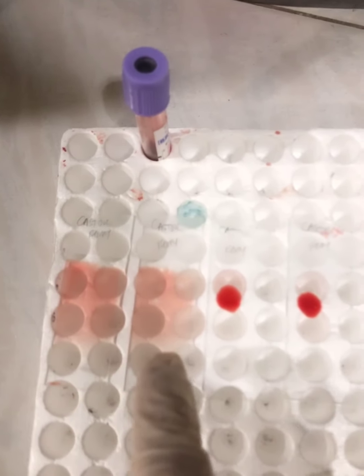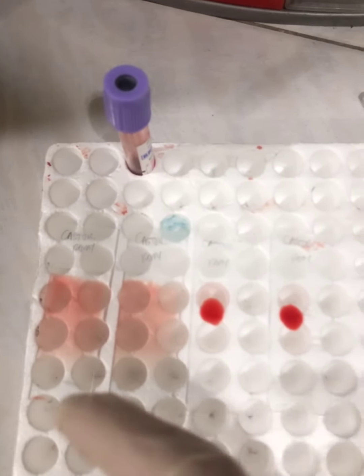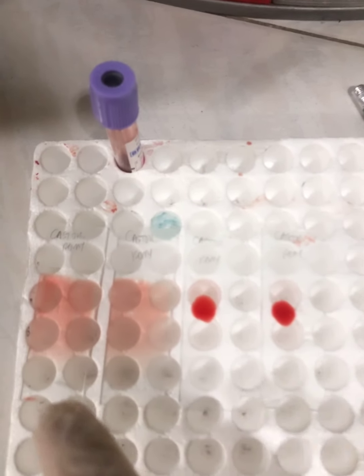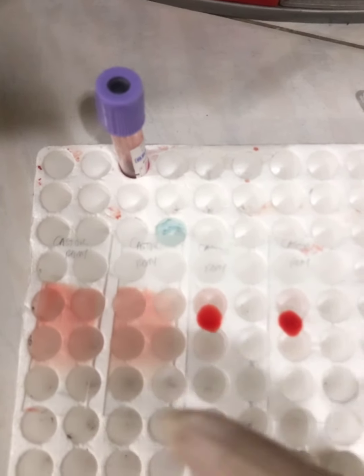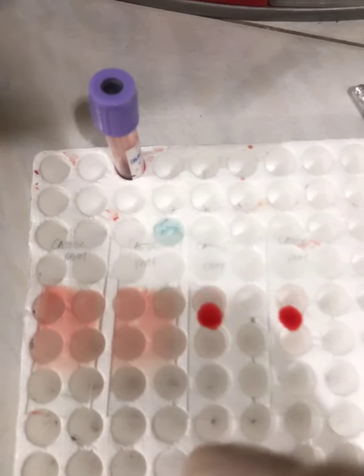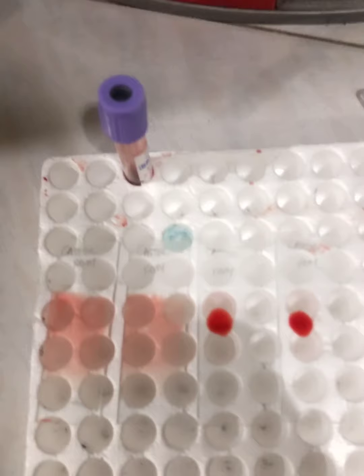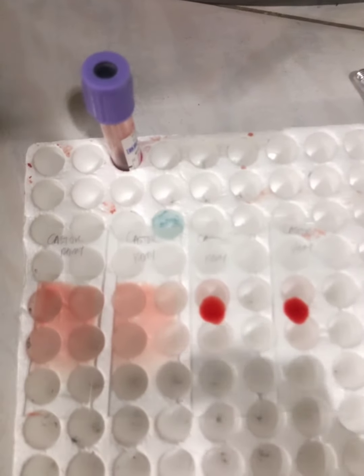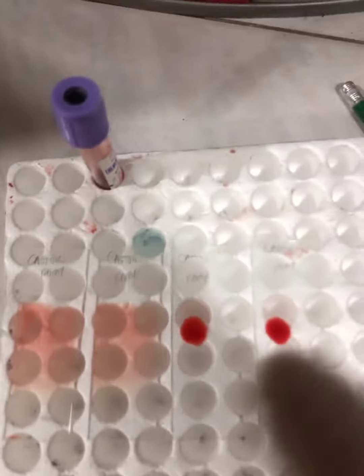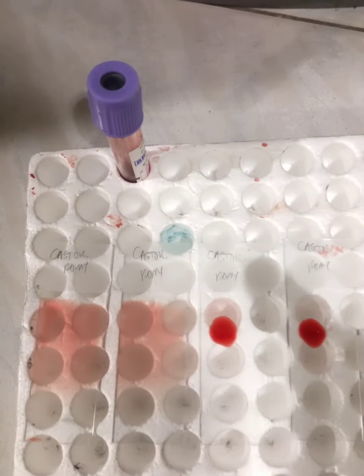Basically the thin smear allows us to speciate the malarial parasite, and at the same time it also allows us to identify the morphology of our RBC, because for each species of Plasmodium, we can identify it also by observing the morphology of the red blood cells. Like in the case of Vivax, the red blood cells would be enlarged and pale, whereas falciparum and malariae would have a normal RBC morphology. And for ovale, the cells would be enlarged and oval.